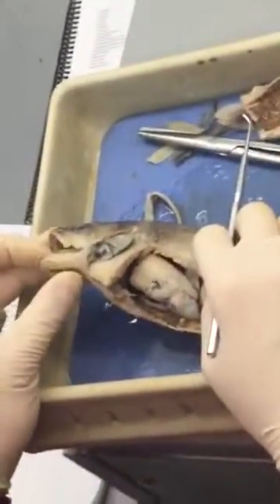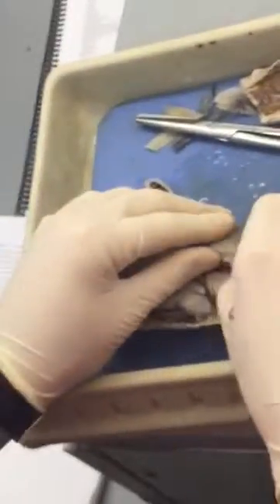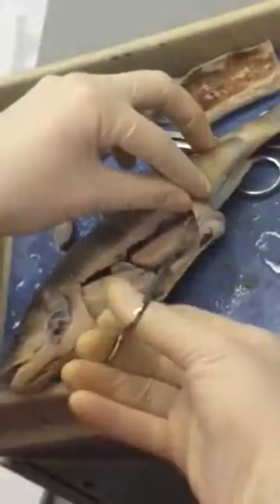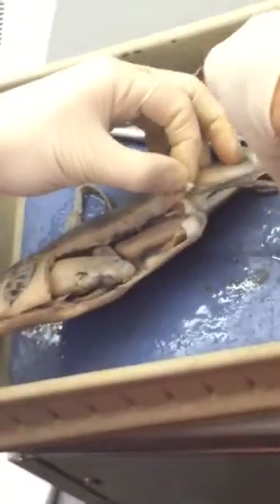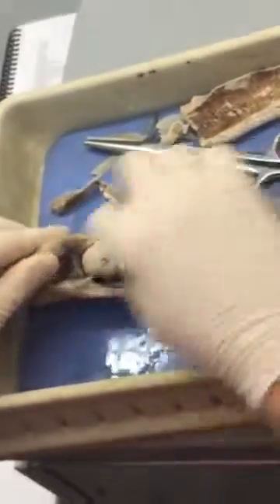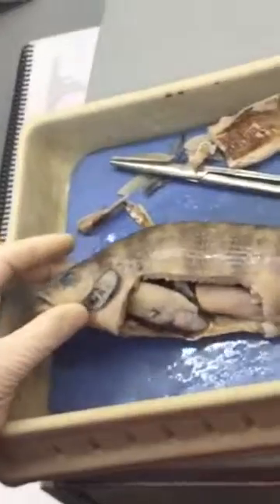The first thing we really want to do is find the esophagus. Once we find the esophagus, we can figure out a lot of the other stuff. Let's cut a little bit from the back. Start by finding the esophagus — that's going to be your starting point. An easy way to find the esophagus is actually using your probe.